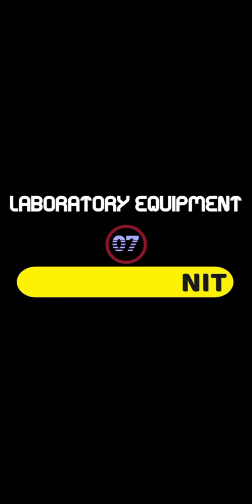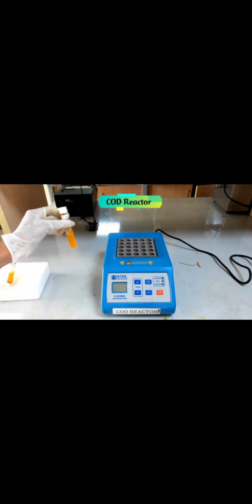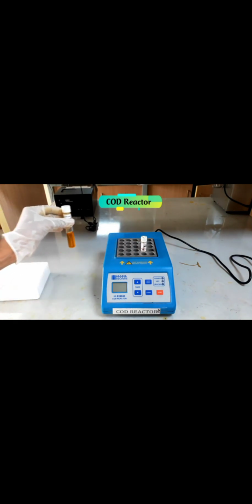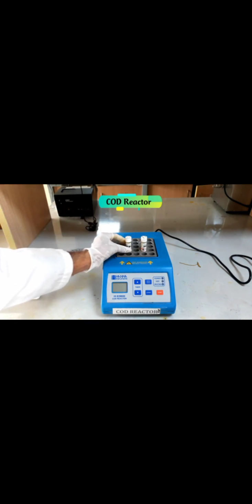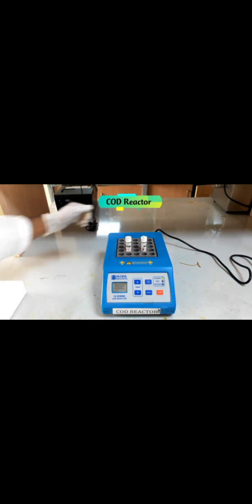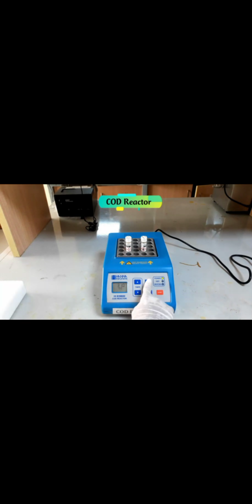Chemical oxygen demand reactor. A chemical oxygen demand reactor works together mainly with a spectrophotometer to detect chemical oxygen demand in water, which is one of the important water tests. Before the chemical oxygen demand reactor is used, it must be calibrated to ensure an accurate result.